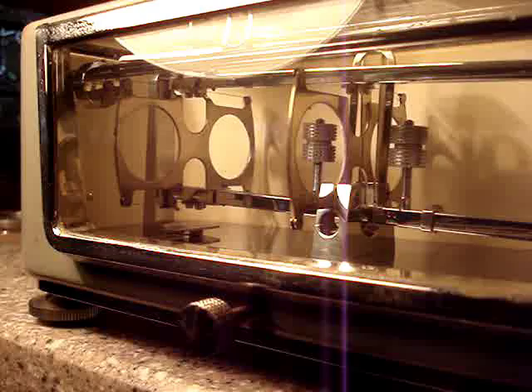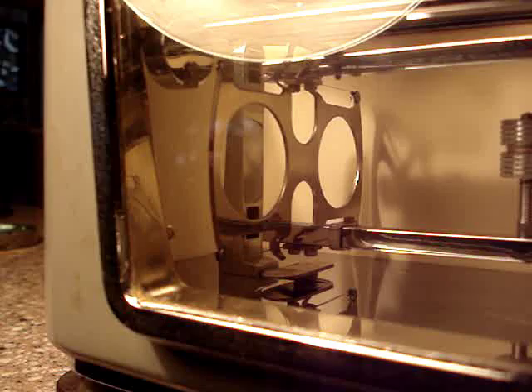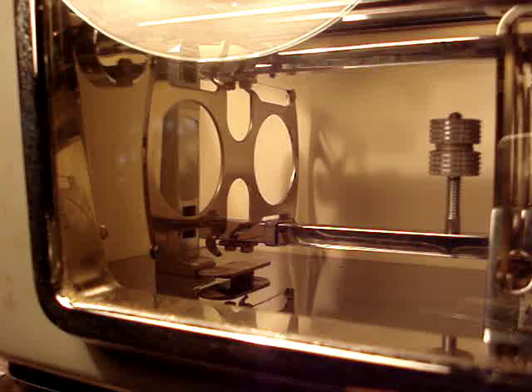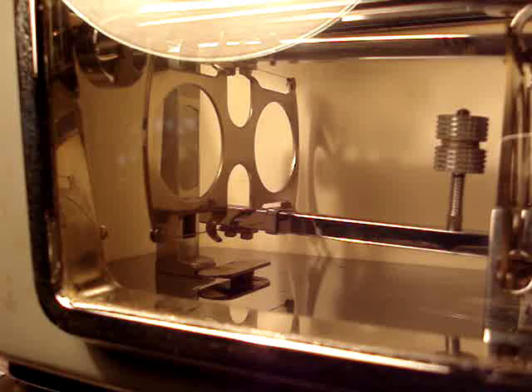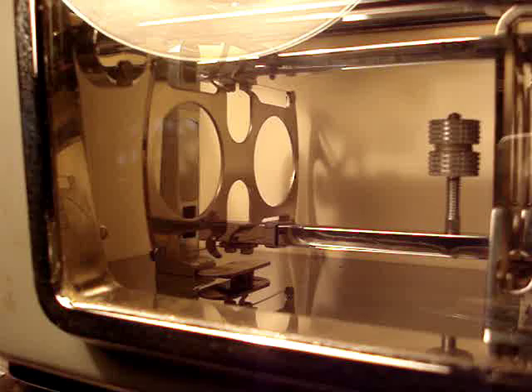Hopefully you can see the beams in this movie. Let me move the camera a little closer. You can't zoom in with this camera while the movie's in motion. I'll give you a little slow pan here — maybe you can see the mechanism moving. I'll stop right there for a minute and let you see this. See the mechanism rising on the left? It's rising now, and now it's going downward, very slowly.